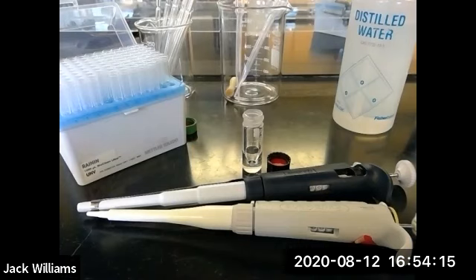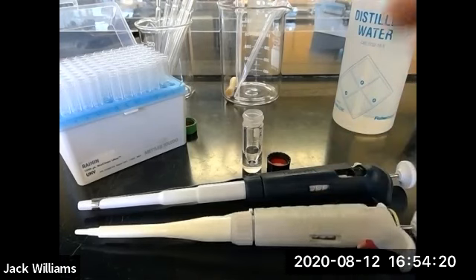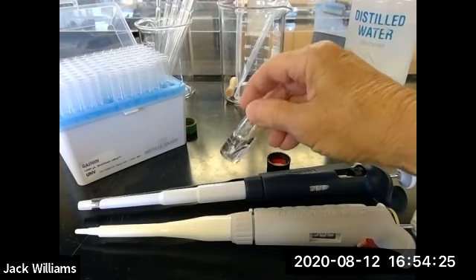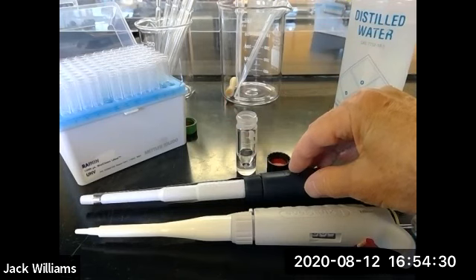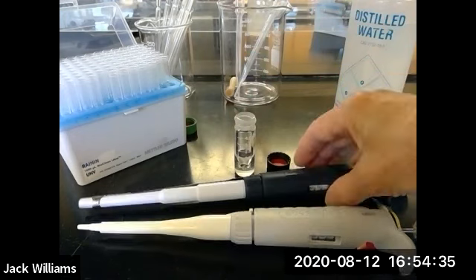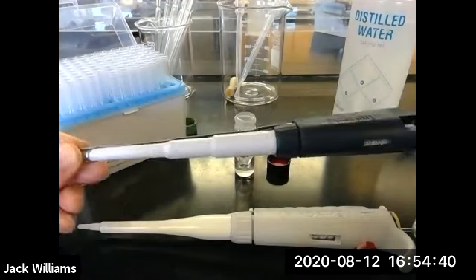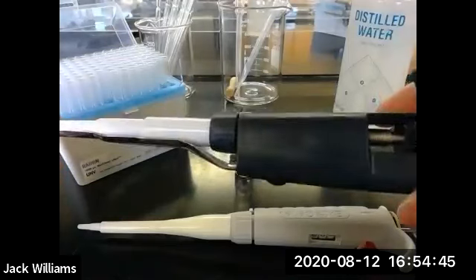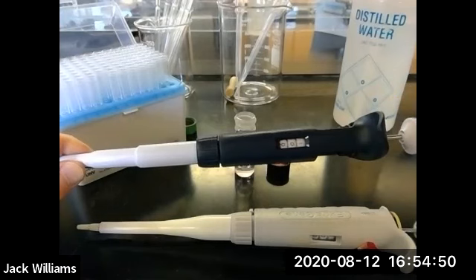Okay, folks, continuing on with the second part of the experiment. You're now going to place 600 microliters of methylene dichloride using an automatic delivery pipette into the conical vial containing the benzoic acid. So this is an automatic delivery pipette. They come in various sizes. There's a marking on the side here, which you can use to tell how much liquid you're taking out.